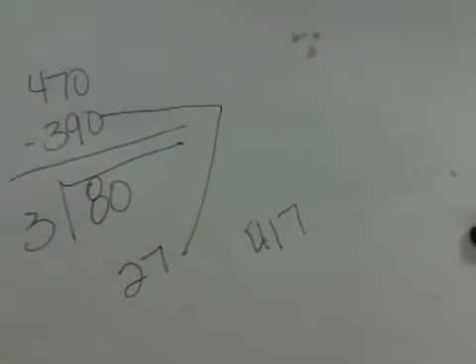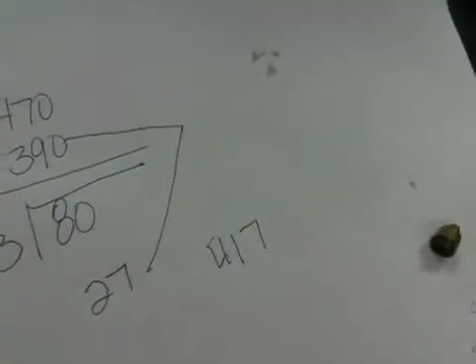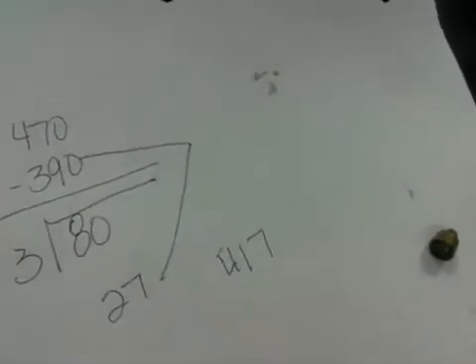So the dropping point was 417. We checked the sample once before, didn't we? We've got a very similar number. Okay, good. Thank you.